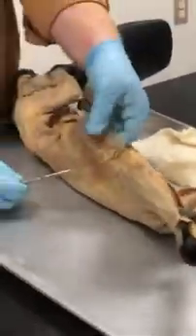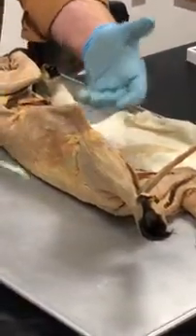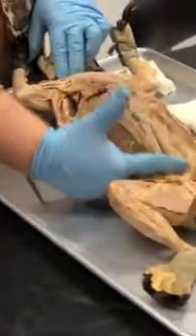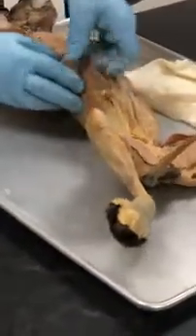All right, so in the abdomen, and again, keep in mind, the xiphohumeralis goes all the way down here. The xiphoid process is way down here. Because the cat is so long, there's a xiphohumeralis. You can feel it there. So this is the thorax of the cat. This is the abdomen of the cat. Okay? So this is going to be your abdominal muscles over here.